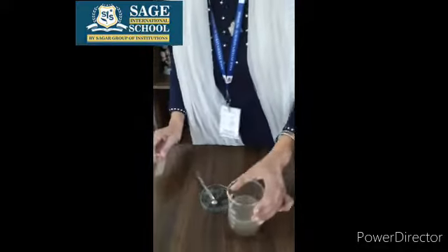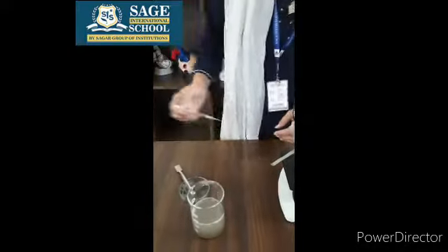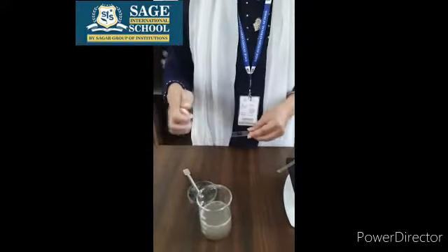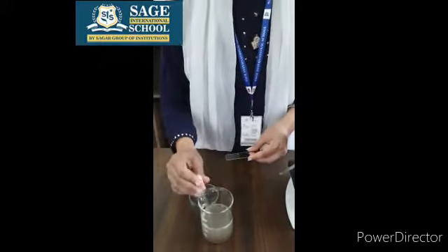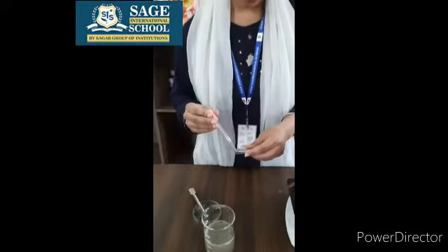After some time, we will see that this soil is settled down. Now what we will do, we will take a drop of water on a glass slide.